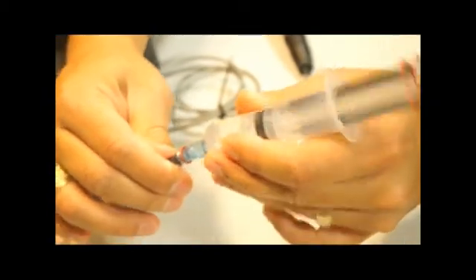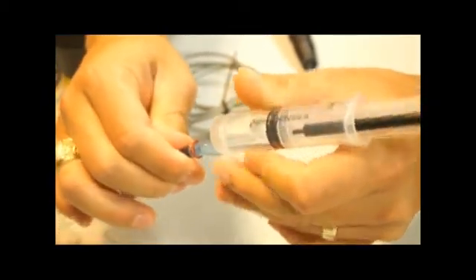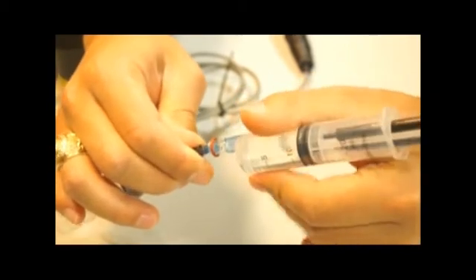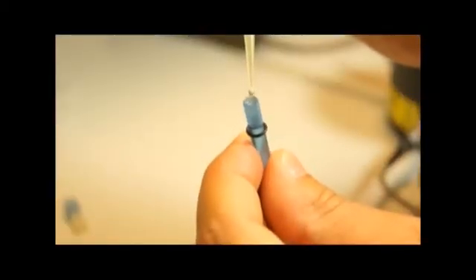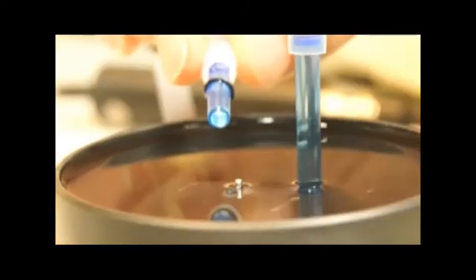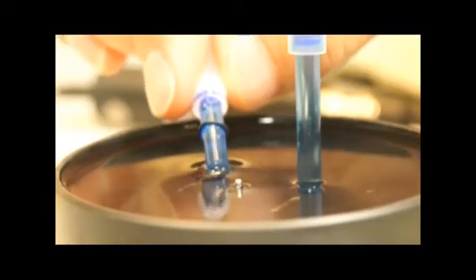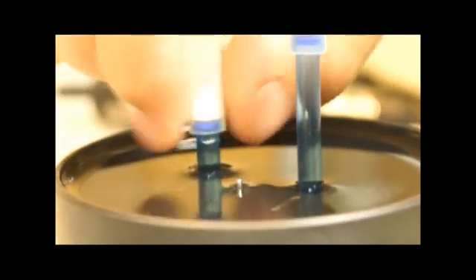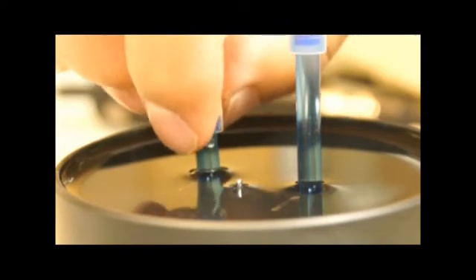Your goal now is to connect the tensiometer to the HYPROP without trapping any air. If you're careful, you should be able to do so without much difficulty. Start by using the droplet syringe to put a nice film of degassed water on the tensiometer. Slide the tensiometer into the port at an angle so the meniscus touches the water before the tube itself does.